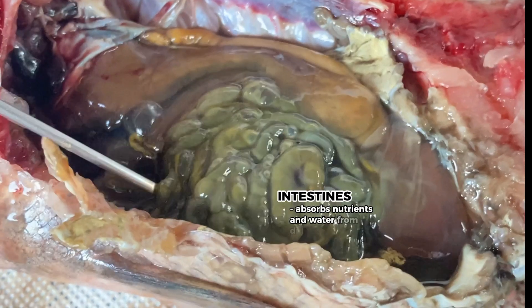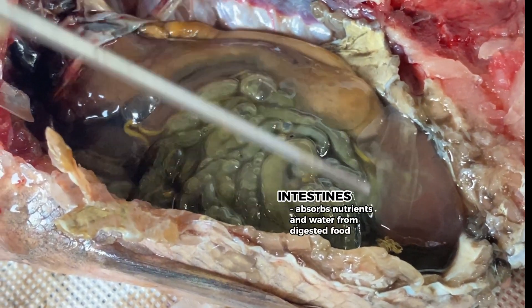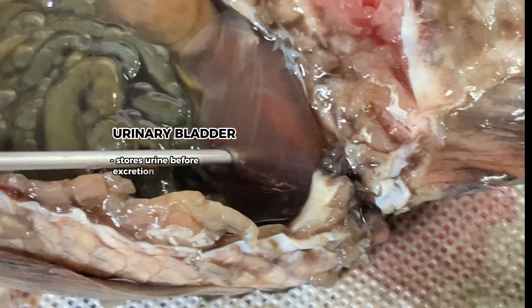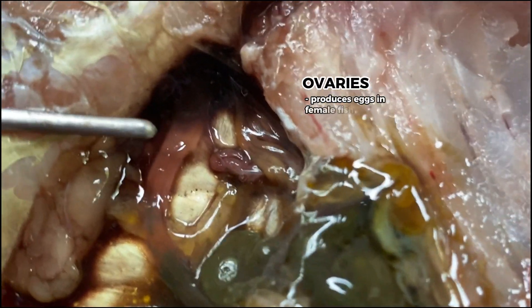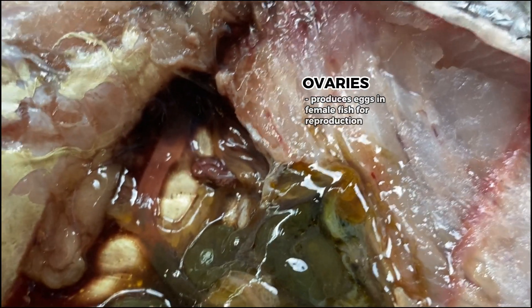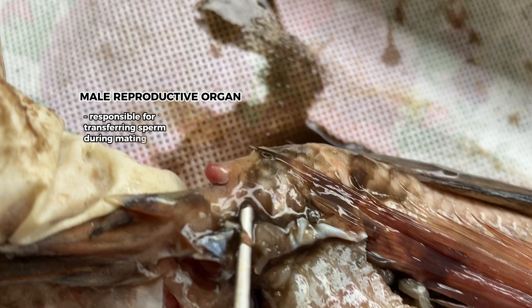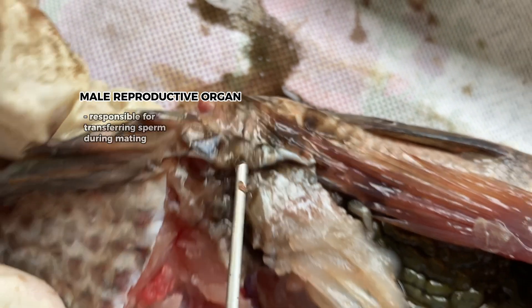Intestines: they absorb nutrients and water from digested food. Urinary bladder: it stores urine before excretion. Ovaries: they produce eggs in female fish for reproduction. Penis: it is the male reproductive organ responsible for transferring sperm during mating.